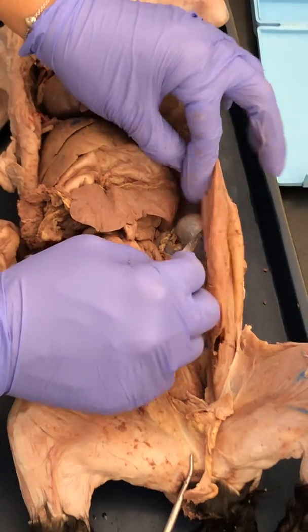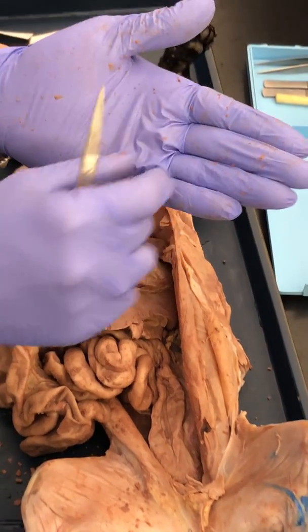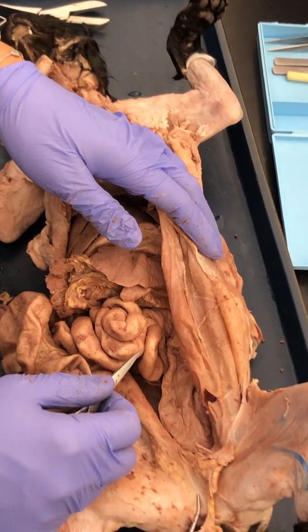Okay. If you cut the kidney open, okay, cut it right open, right in half, the outer part will be the cortex. The inner part will be the medulla, and right where it converts to the ureter, that would be the pelvis, okay? The renal pelvis.